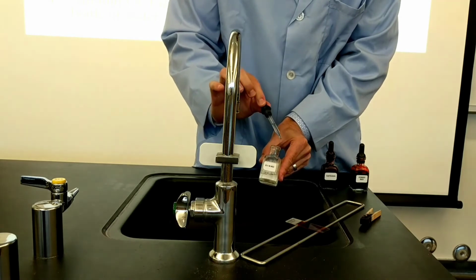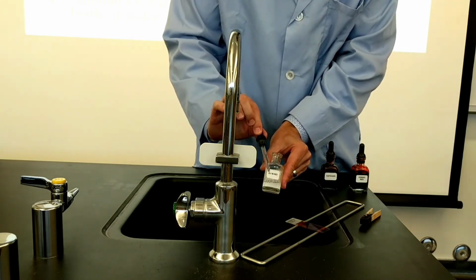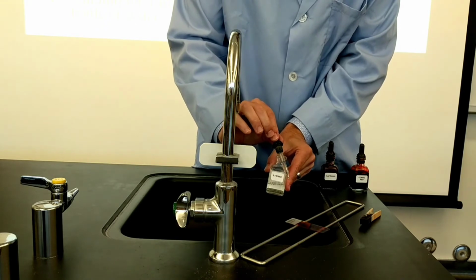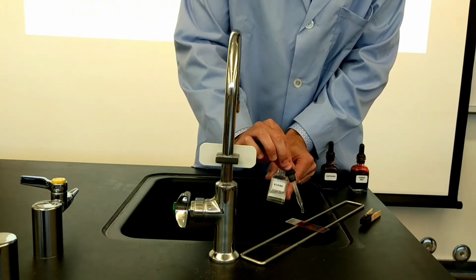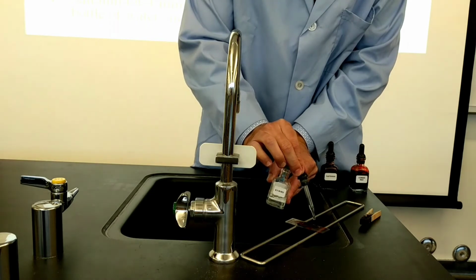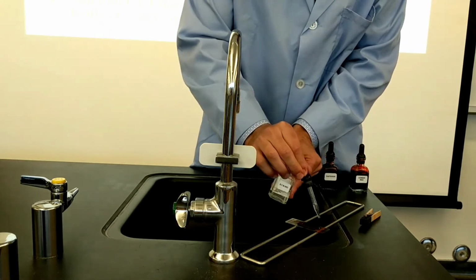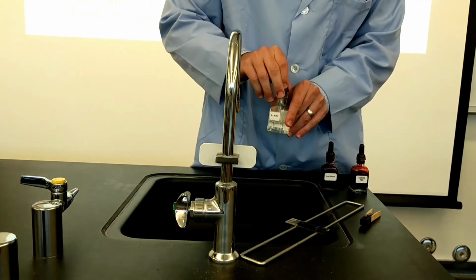Now I'm going to flood the whole slide with hydrochloric acid. You want to make sure that you get all the bacteria so they're all dead, and that it fully covers the slide so that it changes its color as well. You'll see that because of the dramatic pH change, as the hydrochloric acid reduces the pH to almost 1, the Congo red turns into a midnight blue.